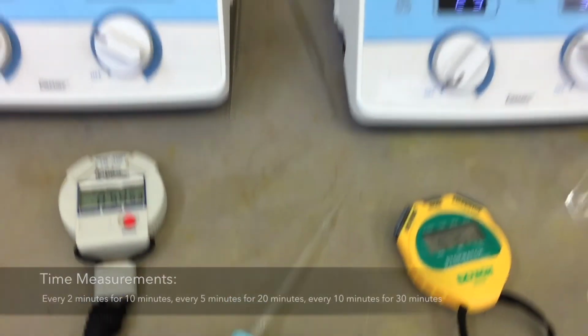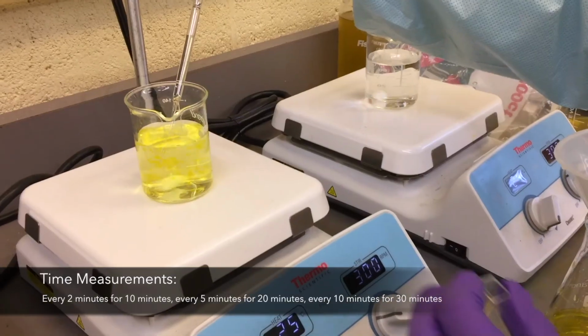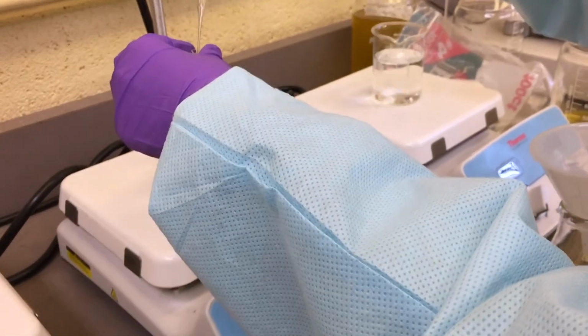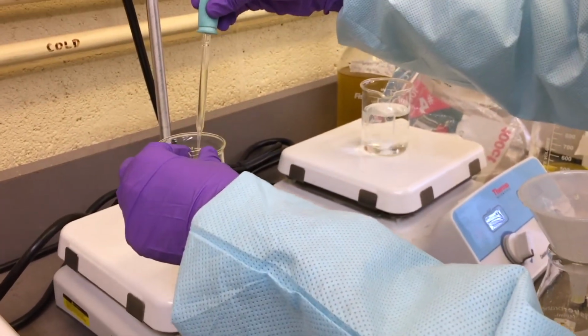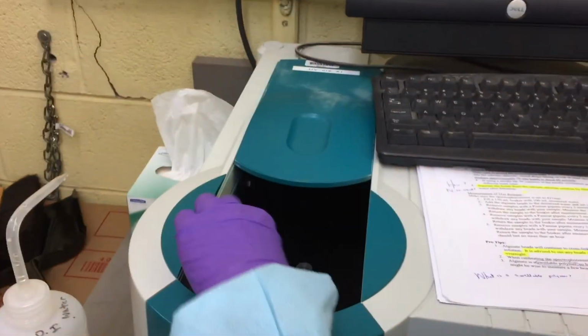Absorbance of the solution was taken every 2 minutes for 10 minutes, every 5 minutes for 20 minutes, and then every 10 minutes for 30 minutes. The absorption of the solution was taken by pipetting the solution into a clean cuvette, filling the cuvette at least 3/4 of the way, and then using a UV-vis spectrophotometer to take these measurements.